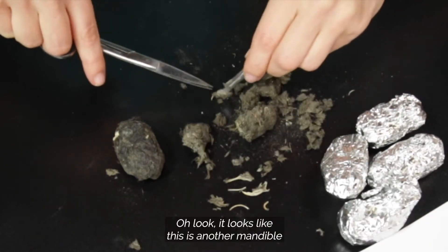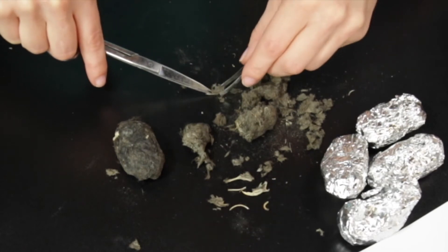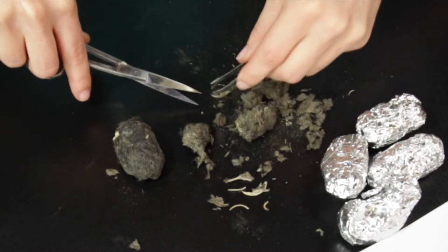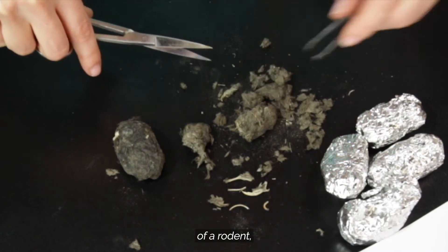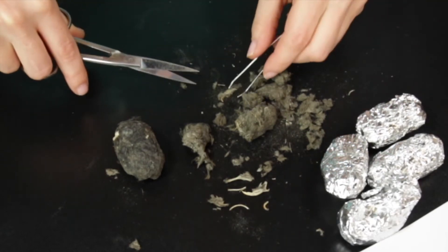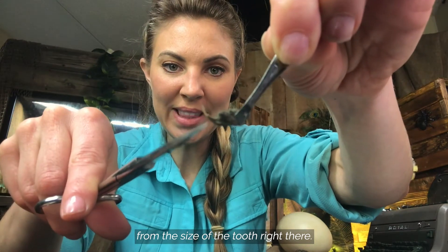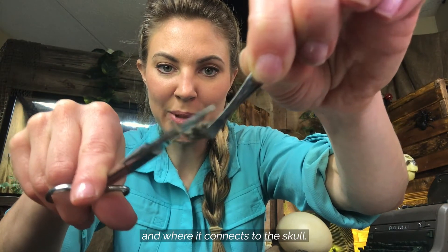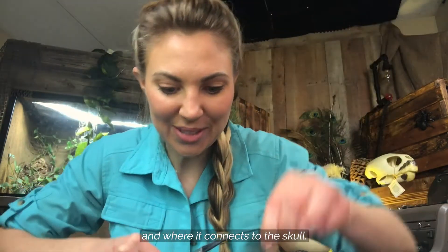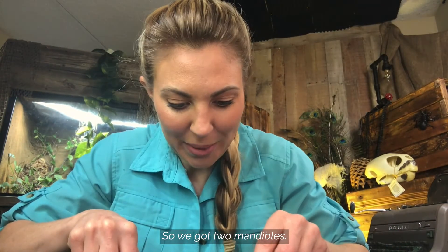It looks like this is another mandible of a rodent. You can see the size of the tooth and that's the lower mandible and where it connects to the skull. So we got two mandibles.